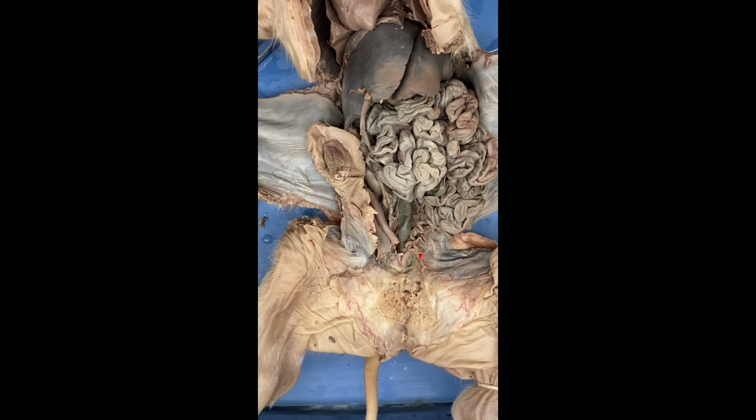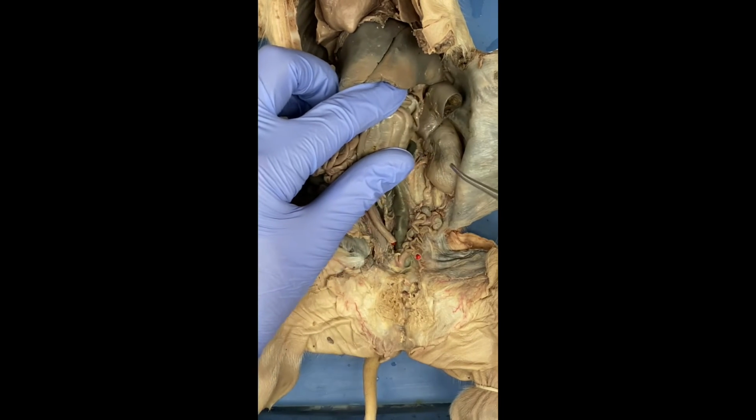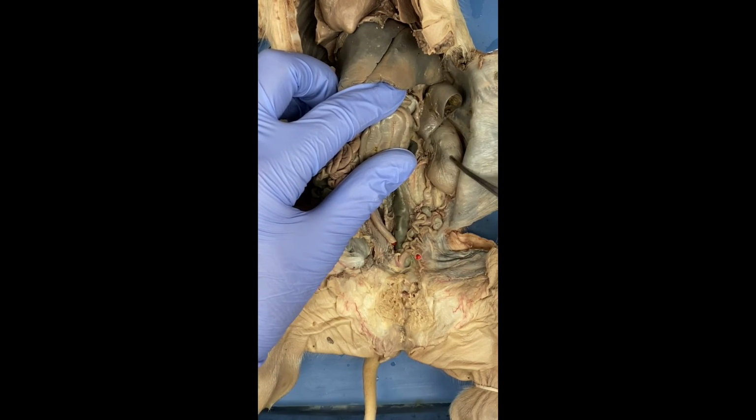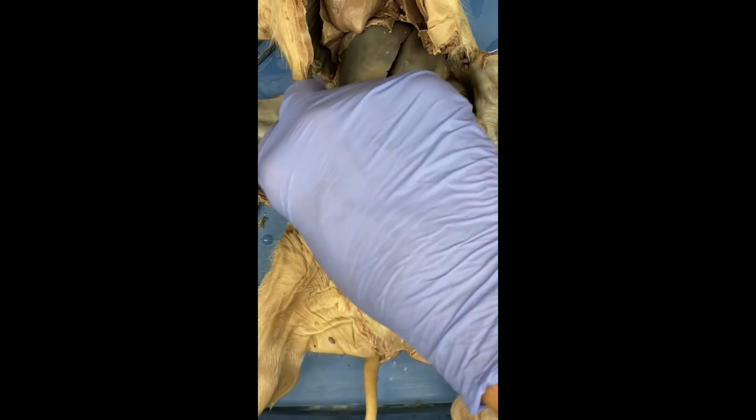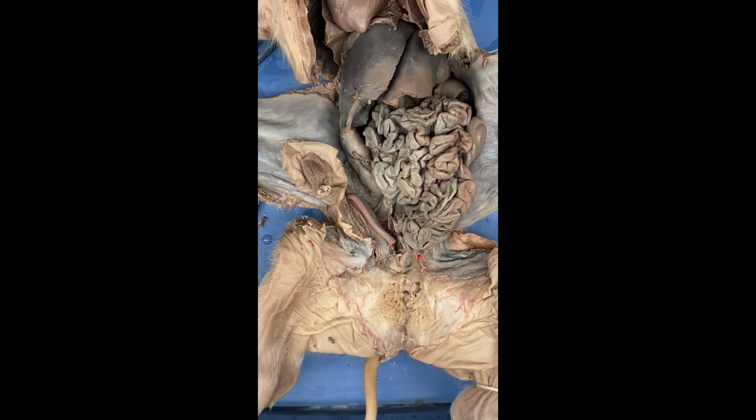All right, we are on our final activity of the fetal pig lab, which is the urogenital system. This is going to have to include both the urinary system and also the reproductive systems. So we will start with the kidney. This right here is the kidney. There's one on this side, and there's going to be one right here, which I've kind of moved around a little bit. The kidney's job is it filters the blood for wastes and turns it into urine.